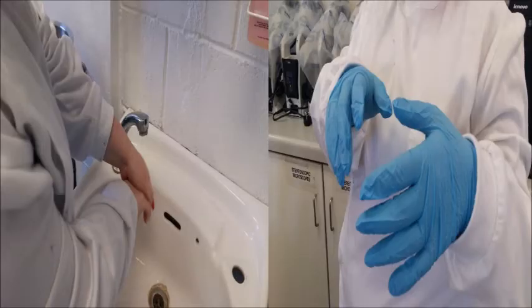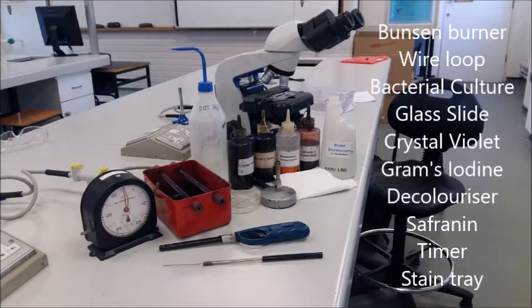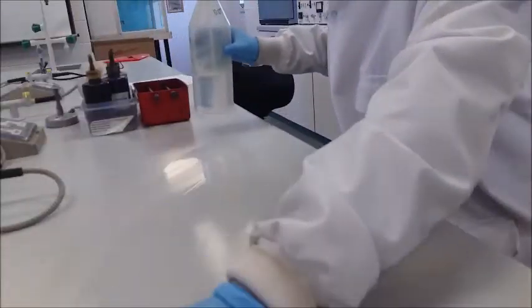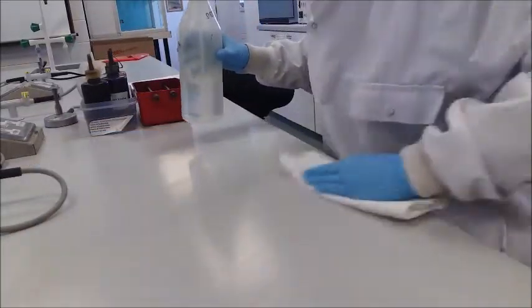We must wash our hands and wear gloves. These are the materials and reagents we will use. Before we start, the bench must be wiped down with Trigene.